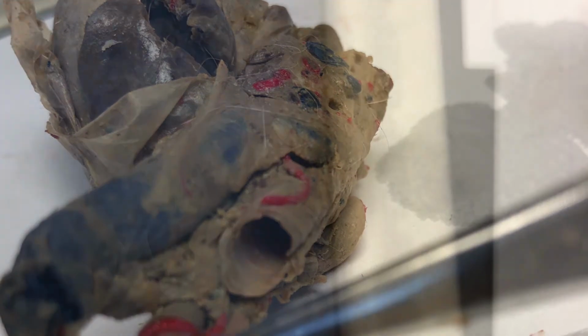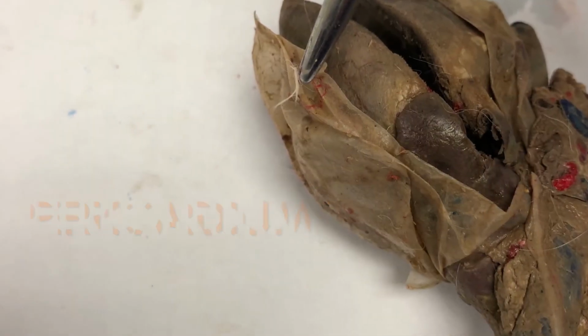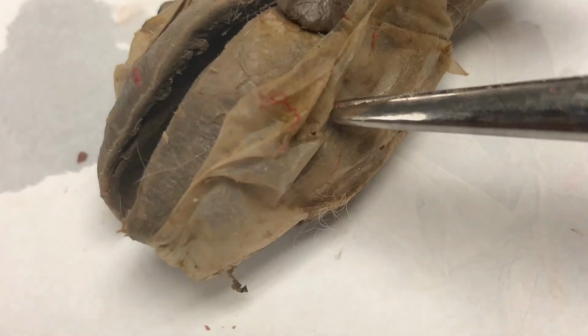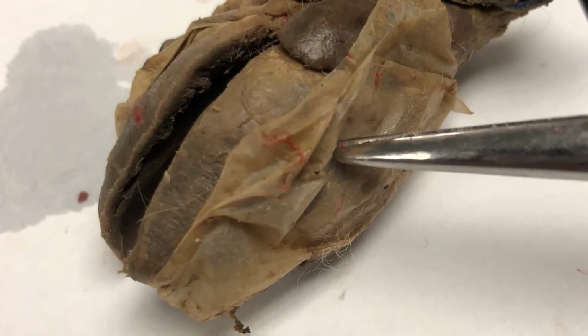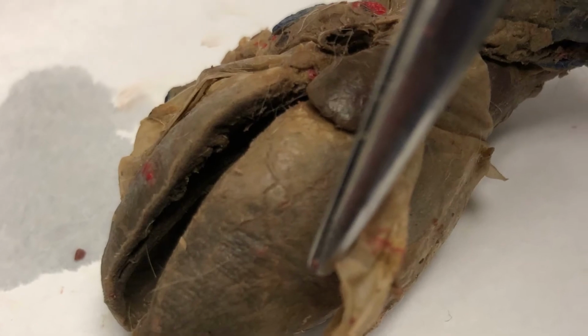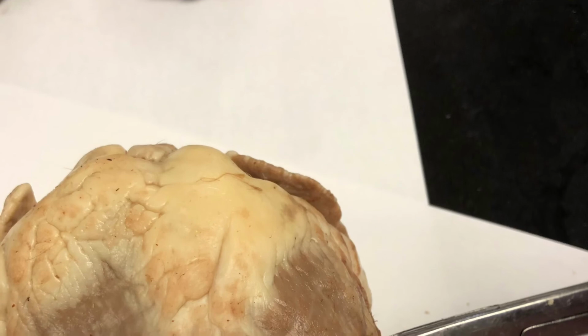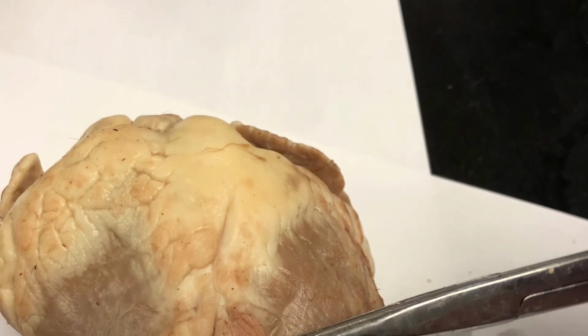The aorta. Here's the pericardium again, the sac that surrounds the heart. Here's a couple pictures of it on the cat heart. Here's our sheep heart.